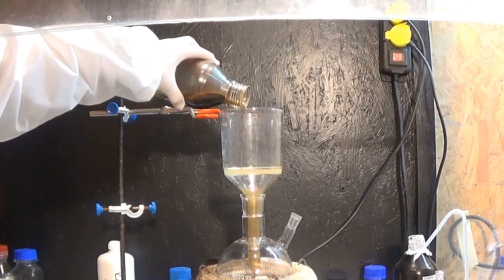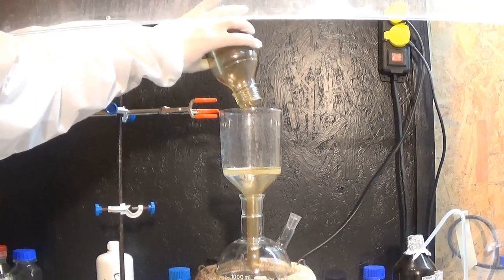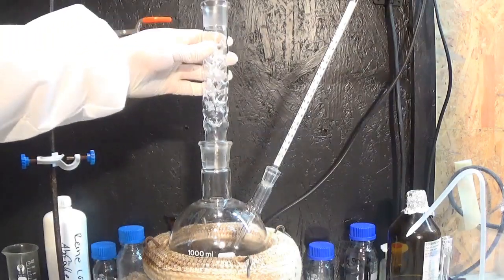At the end of the pouring you can see the solidified paraffins that formed a gel with some of the lighter hydrocarbons splashing in the funnel. To get a better separation of the hydrocarbons we install a short vigreux column.